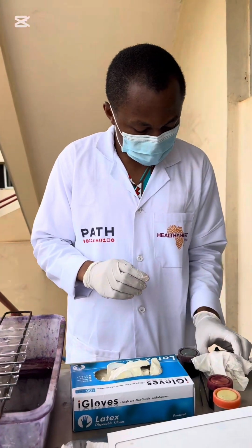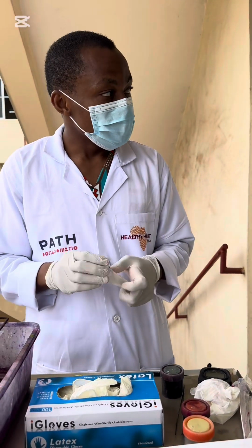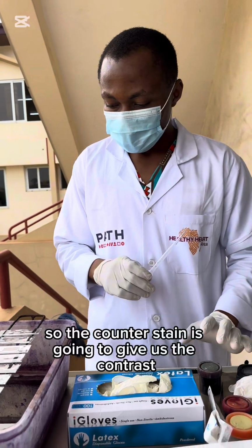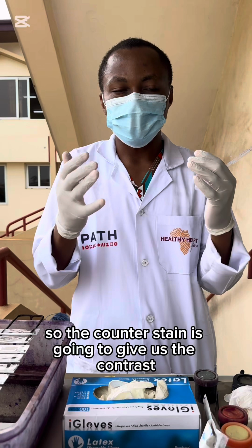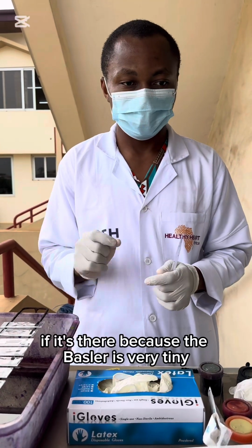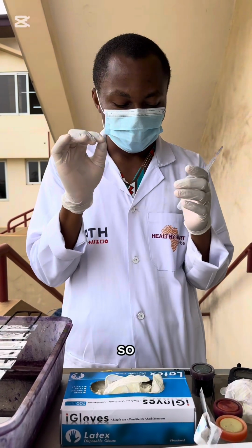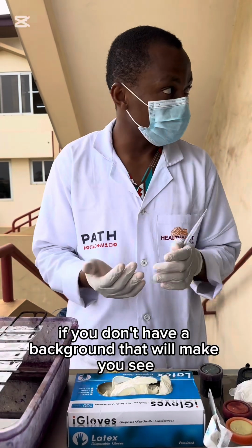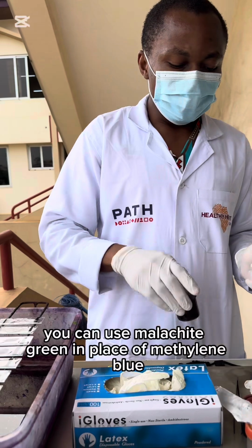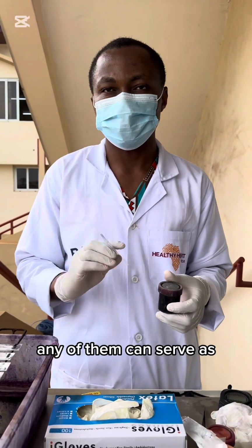Alright, so our next stain is our counter stain. We're going to apply the counter stain for just 3 minutes. The counter stain is going to give us the contrast we need so that we can examine the acid-fast bacilli if it's there. Because the bacilli is very tiny, it will look tiny and pinkish. So if you don't have a background that will make you see, you cannot identify it. You can use malachite green in place of methylene blue. Any of them can serve as your counter stain.